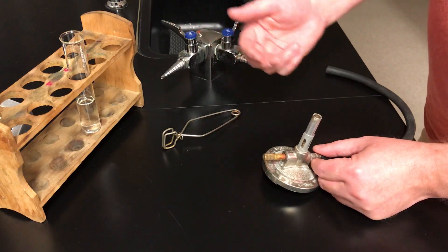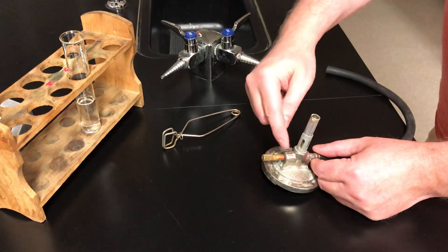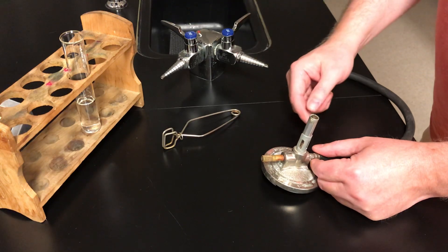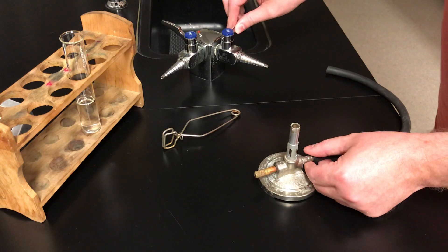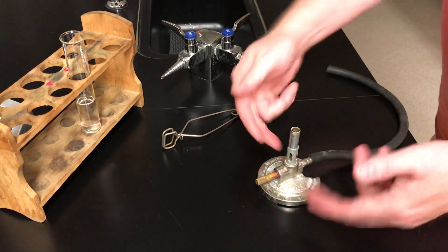If the gas did come out there, it wouldn't be any major problem. There'd be a small flame here, possibly, in which case you would just turn the gas off using its main nozzle over here. And then you could close it.